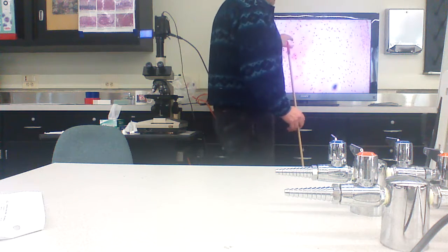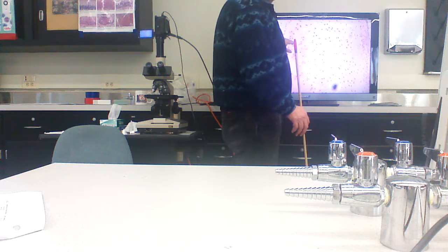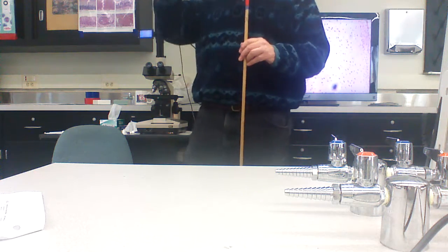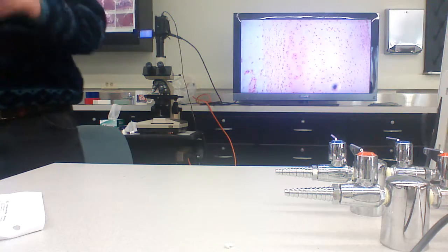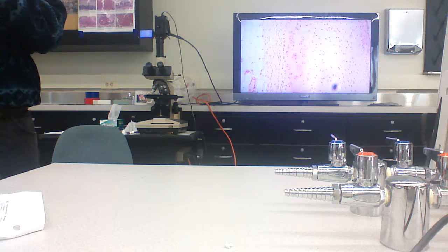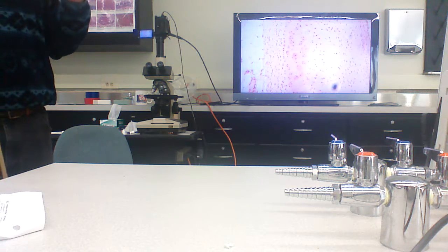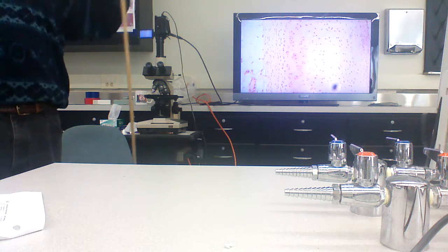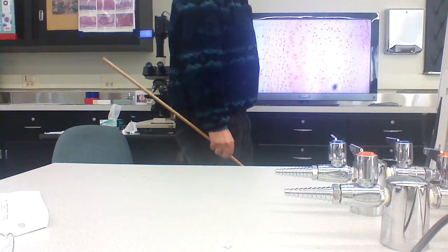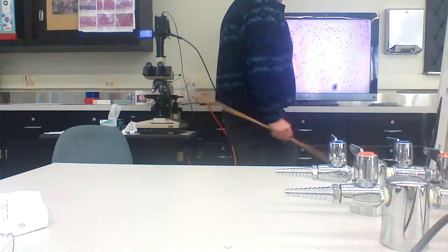So the cartilage cells that now are inside of the cartilage are called chondrocytes. They're cartilage cells, yes. And the chondrocytes are trapped in the cartilage. They can't move through the cartilage. They've literally painted themselves in. And they can push out new stuff, but they can't move. Right? This guy cannot decide, you know what, I want to move down here. Right? He can't do it. He's stuck here, and he's going to grow.